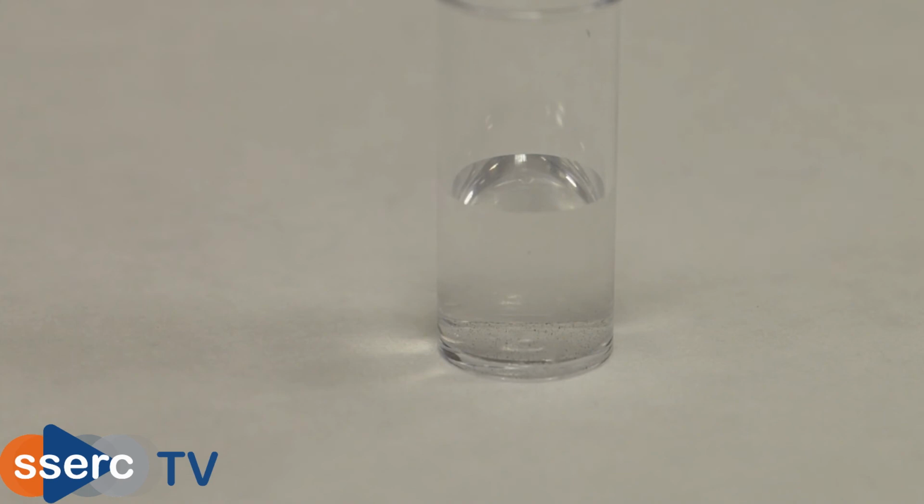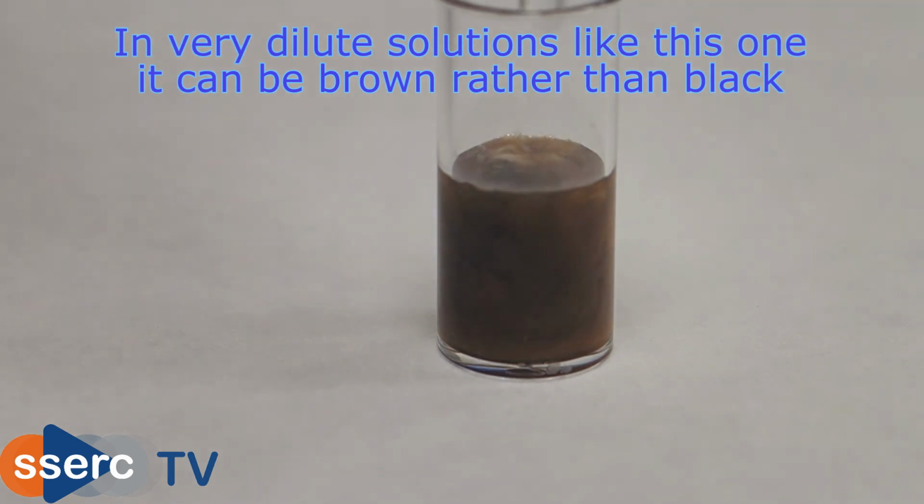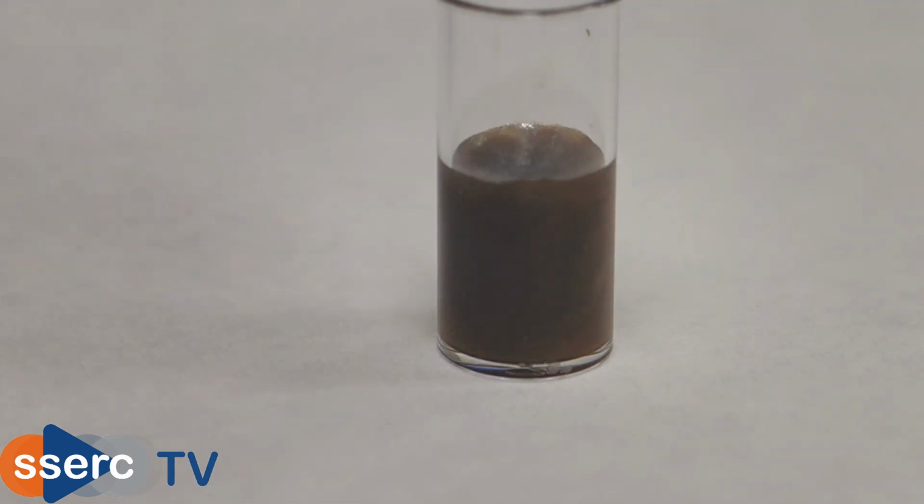To test for sulphides, add a few drops of lead acetate or lead nitrate solution. The sulphide will give a deep black precipitate. There are numerous other tests for many more less common ions, but they can wait for another day.